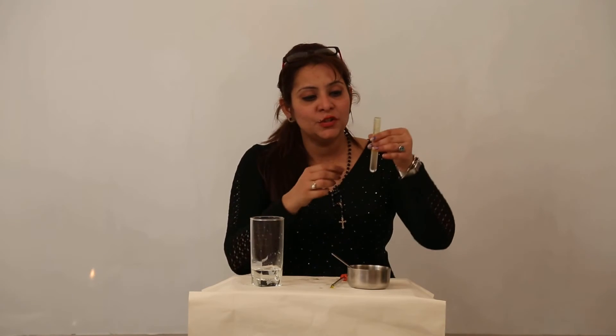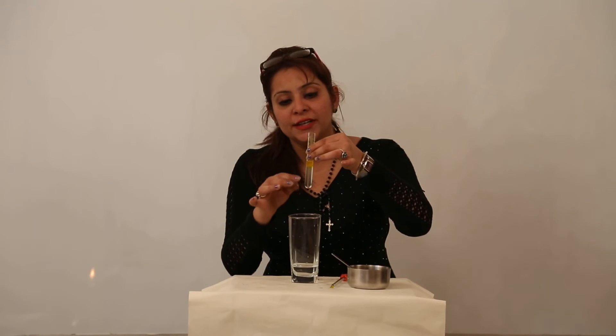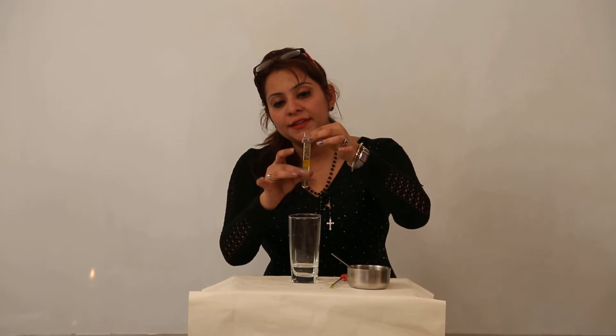If this acted as a separating funnel, I would place a beaker below and open the knob to let the water flow into it. As more and more water flows out, the water level decreases. When the oil level reaches the opening, I close the knob. The water will be collected in the flask and the oil will remain in the tube — this is how you separate two immiscible liquids.